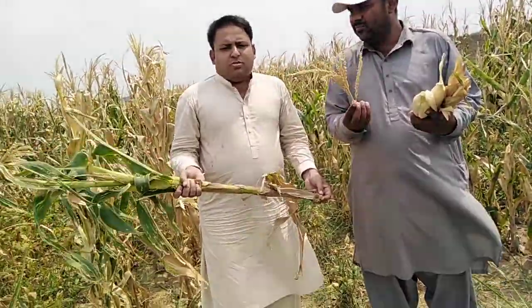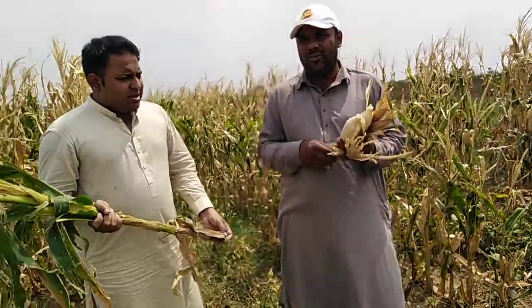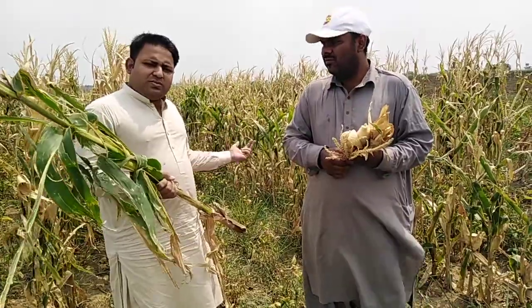Now, I think for this experiment, our sampling today is finished. So how many times do you have to sample for the biomass distribution during the growth of maize? It normally depends on the life cycle of the plant. Its life cycle depends, like in maize, this variety is 100 to 120 days. So you can select stage-wise or days-wise. If you select stage-wise, you can take 2 stages from the vegetative stage and 2 stages from the reproductive period. 4 is enough for maize. If you want to select the days, you can take 30, then 60, then 90, then 120. And it will give you a clear picture of how biomass is distributed in plants.